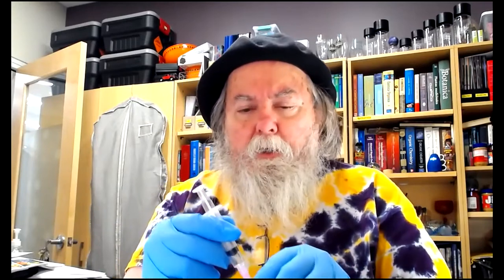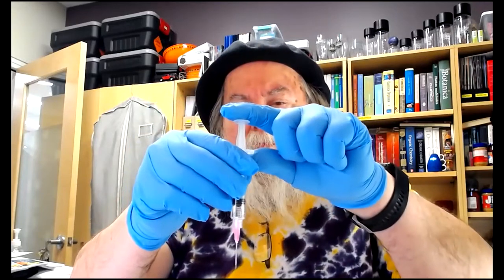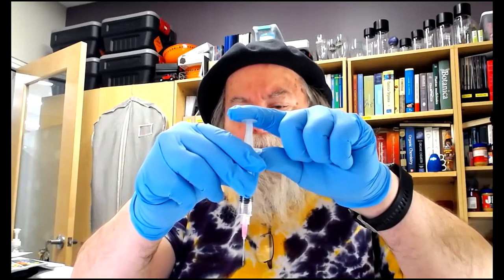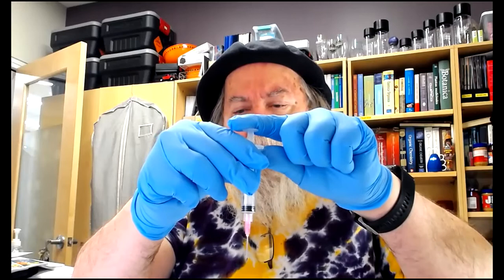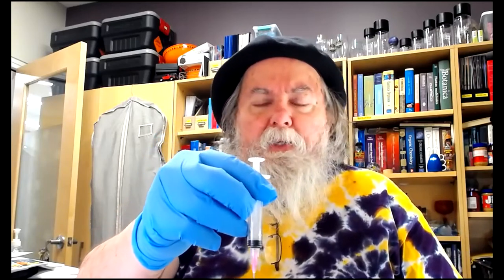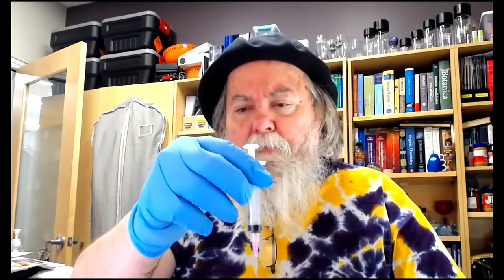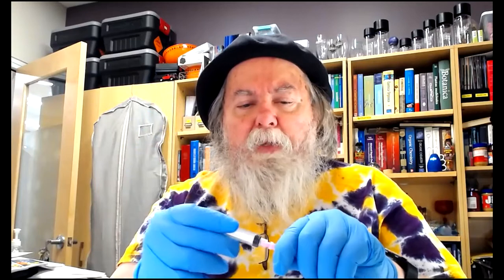When you get back to your hood, you're going to uncap this. There might be a little bit of nitric that comes out, so be very careful about that. You're going to push this through the septum, and then at a rate of about 1/10 of a mil per minute, over 10 minutes, you're going to add the con-nitric. When you're done adding the con-nitric acid to your reaction flask through the septum, you're going to pull the needle out. You're going to cap this.